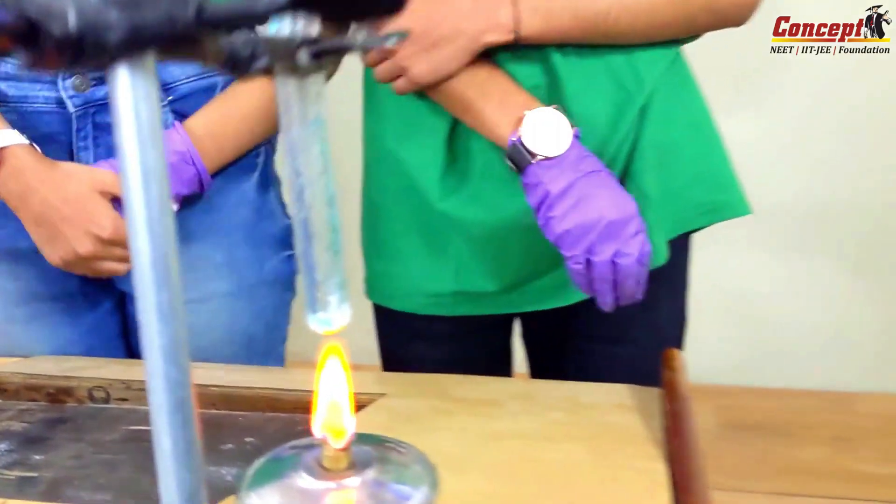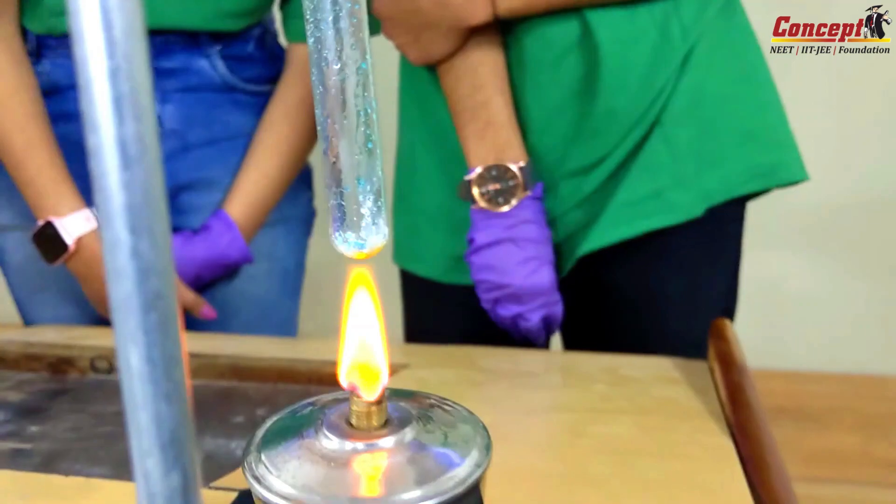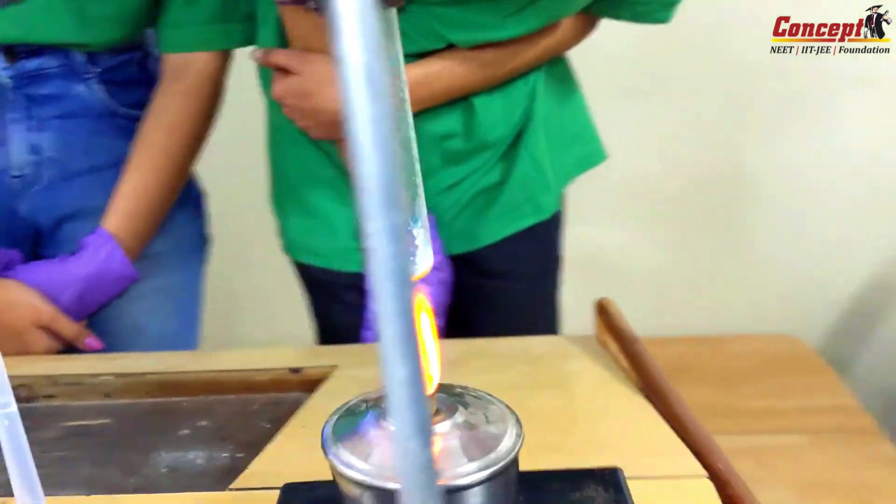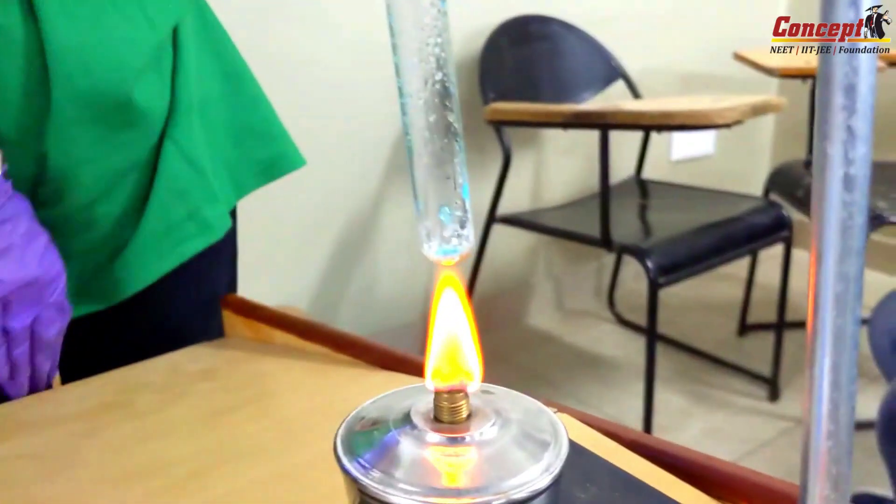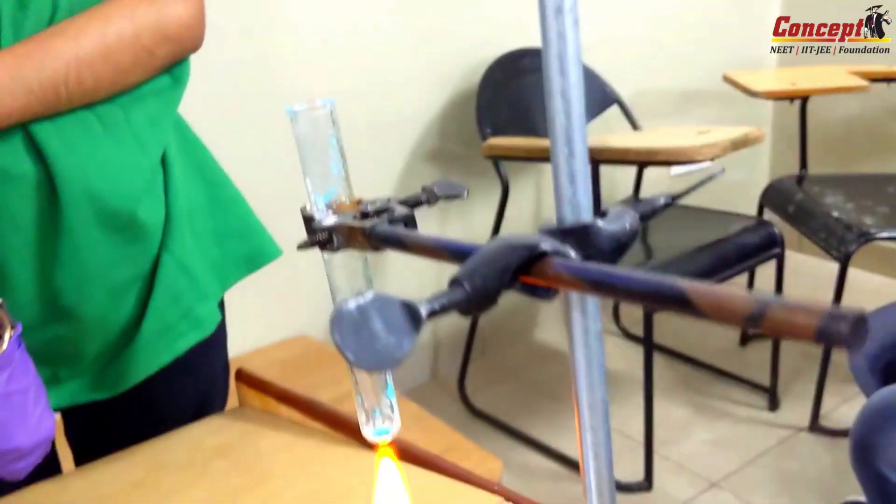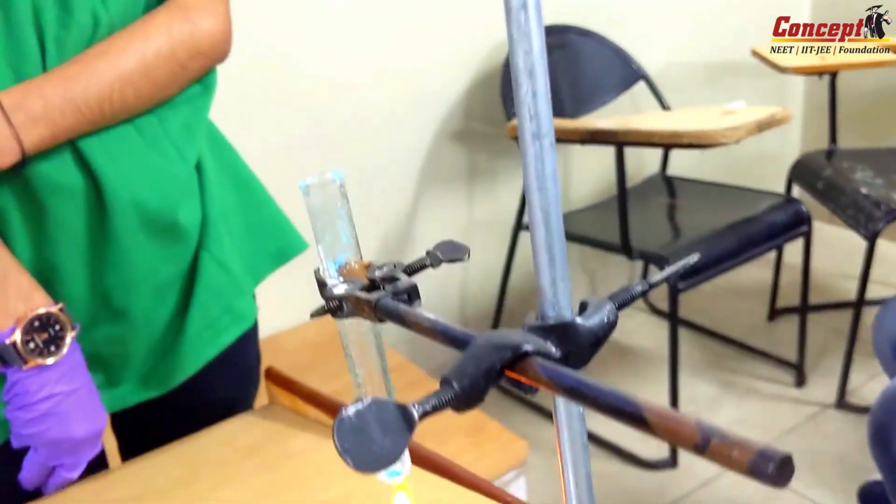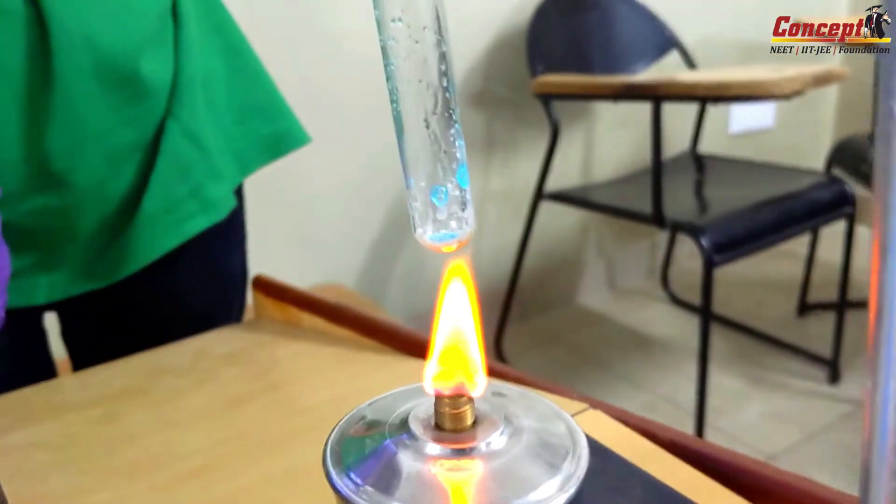Can everybody see the color change? Slowly it's turning into white. Can everybody hear some noise? Yes, this is water vapor being evaporated, this burning sound.